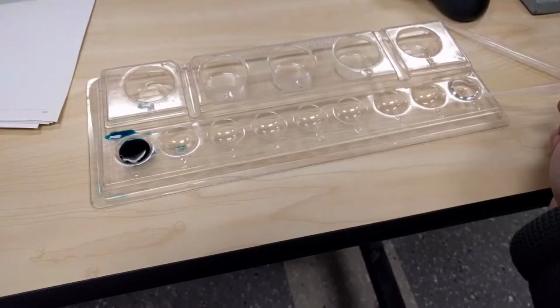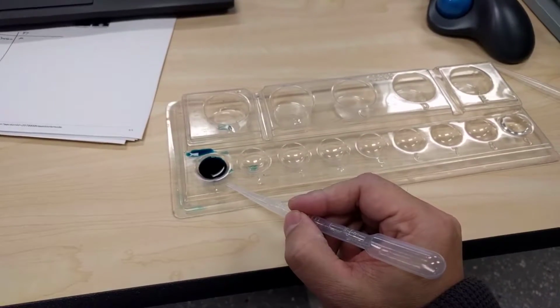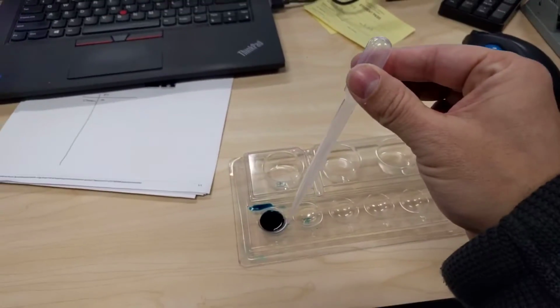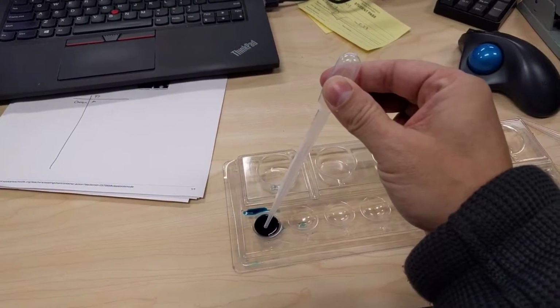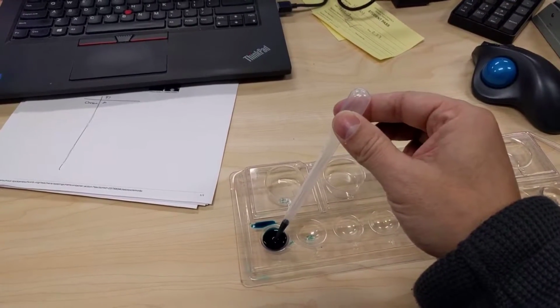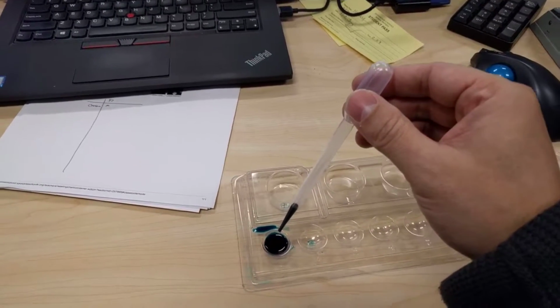And so over here I have some water, and over here I have the stain, bromothymol blue, okay? So before we put it in, we squeeze the bulb just a tiny bit, again, before we put it in. Then we bring it in, and then we take it out. Do not take the tip out until you have it in here.